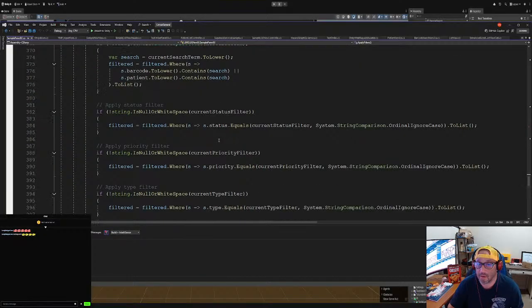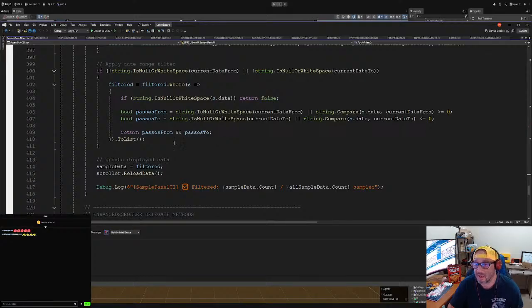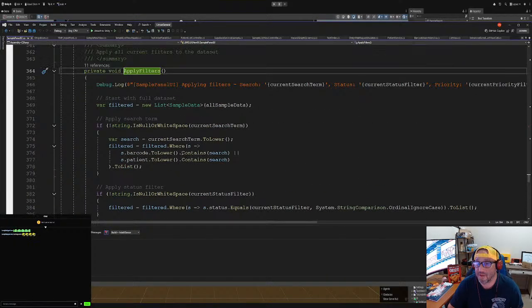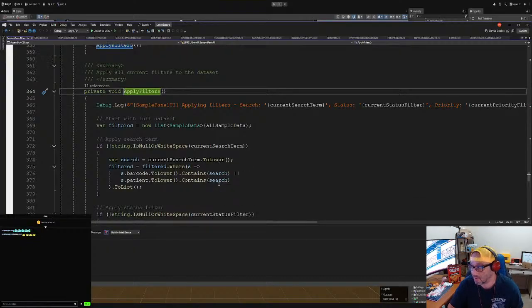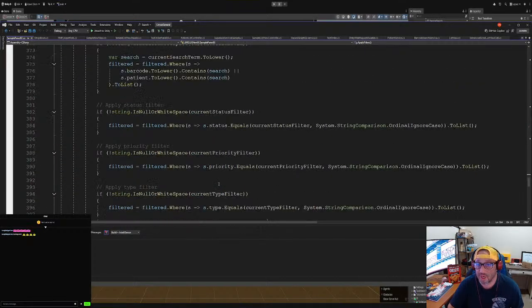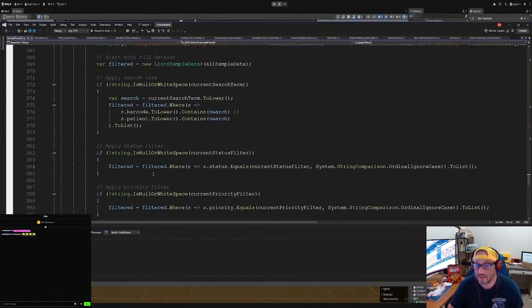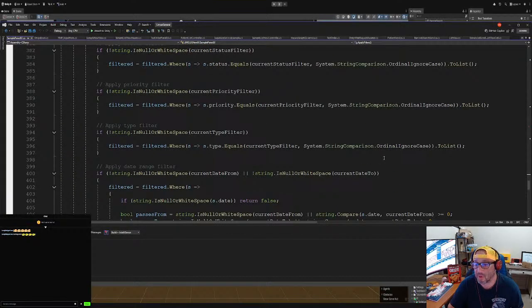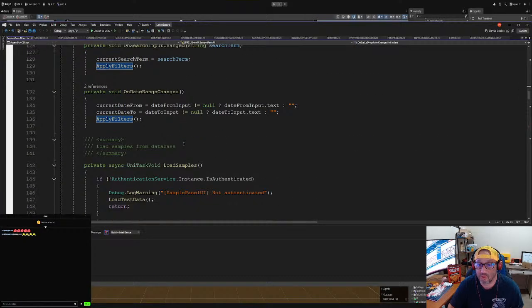You may not want that, or you may want that. We could adjust that later, or you could even have a switch here that says whether you want to filter the data we got or filter it out from the database, which needs a script. You need to write out the script for that. This is using LINQ, and filtering that way. It's filtered where blah blah blah. So let's go back here, and this is what we're adding.